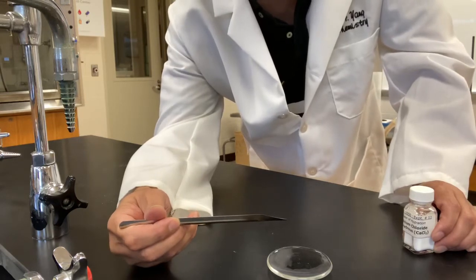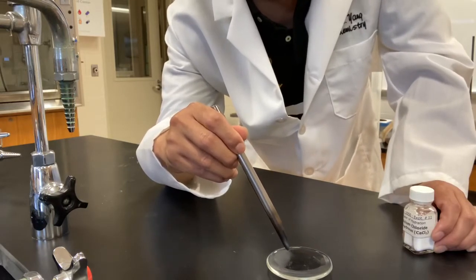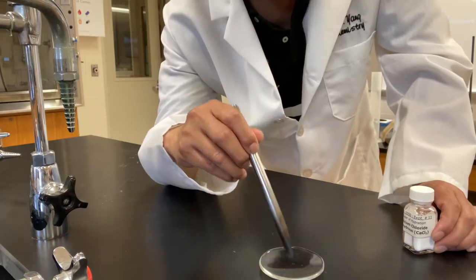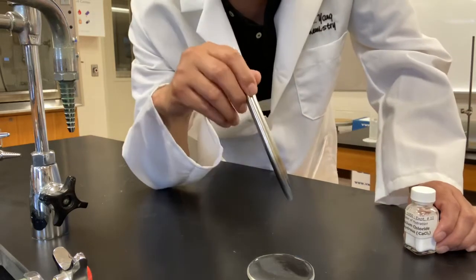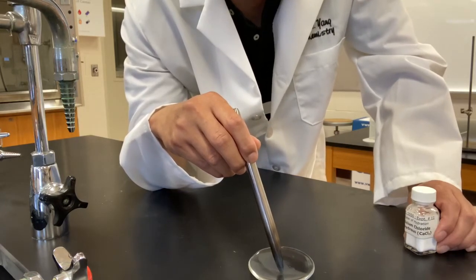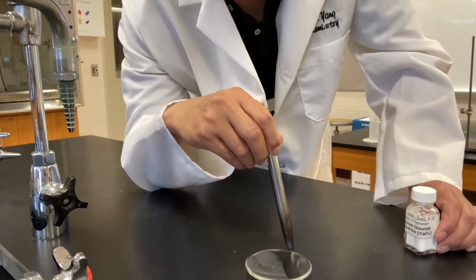Then by the end of the experiment, we're going to come back to look at our calcium chloride sample again to see what will happen to the sample, whether there's any changes in the physical appearance. And that should be the result of absorbing water. Okay? You will record your observation again then. And in the report sheet, you should also include your conclusion or explanation of your observation.